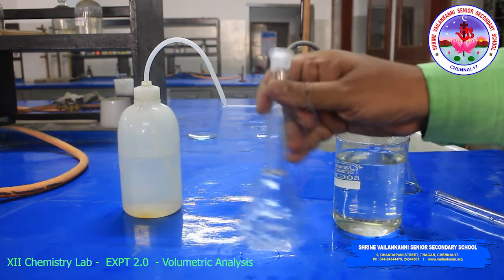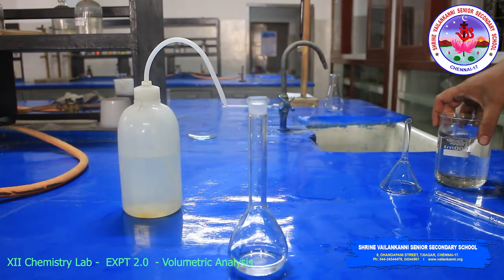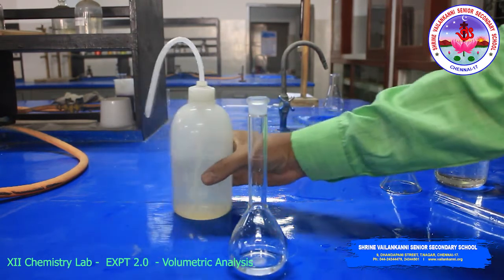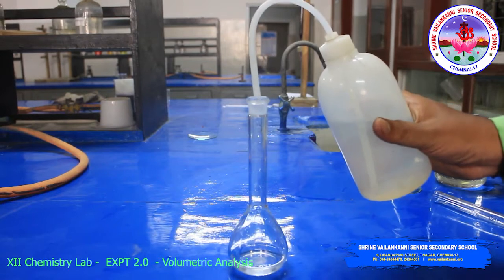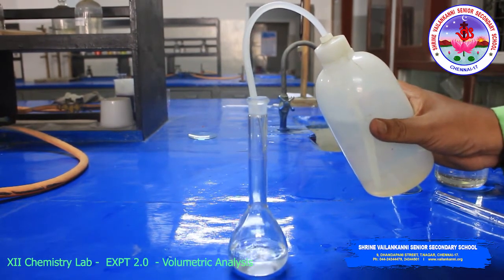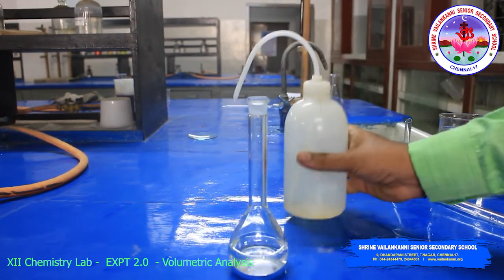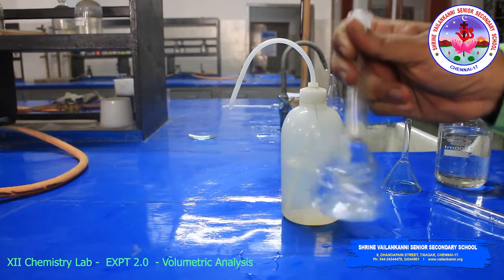Then dissolve the substance slowly. You have to prepare exactly 100 ml of oxalic acid, that is M/50 solution of oxalic acid.